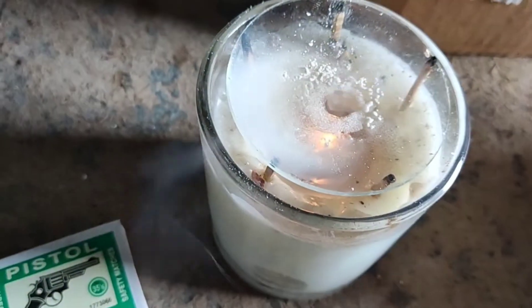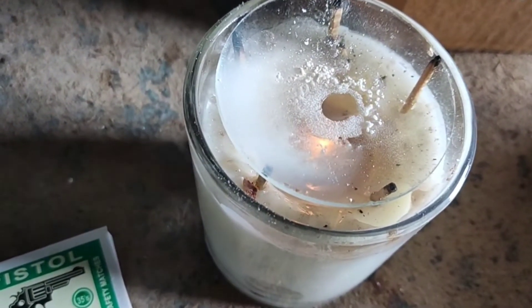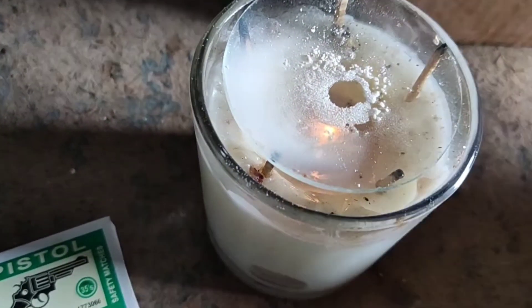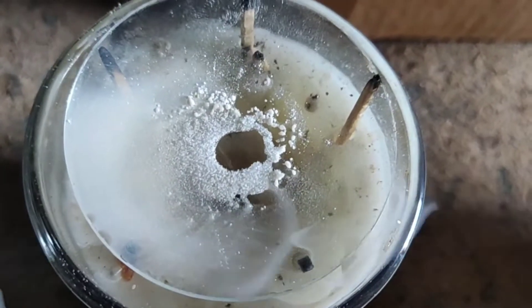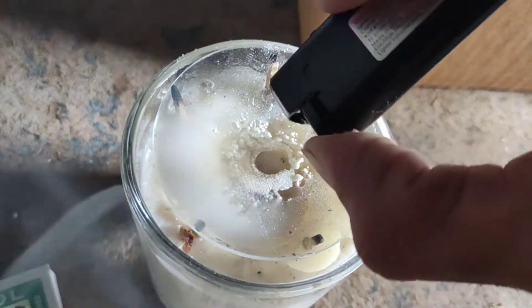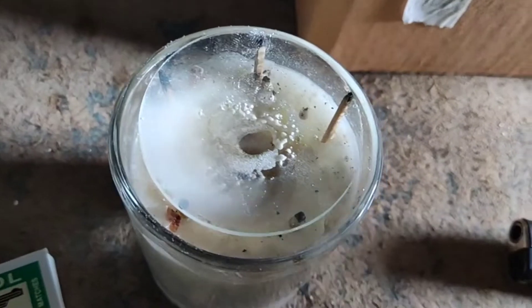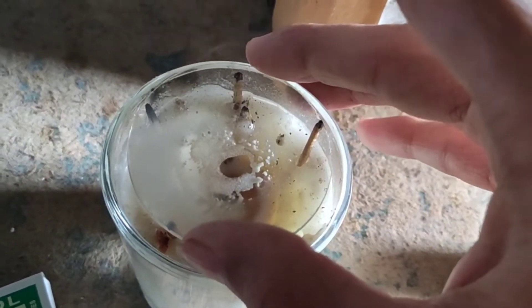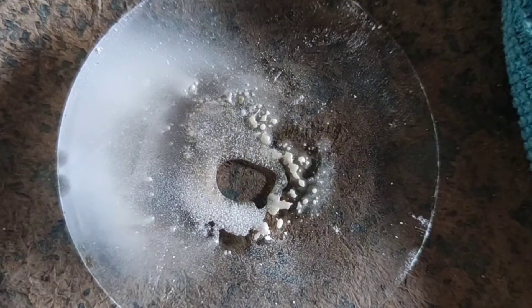There are crystals because the vapors were caught on the watch glass surface — the watch glass has a curved surface. I got a few crystals, which is enough for making a precursor crystal or seeding the solvent process. I'm heating it again just to be sure there are more crystals. We'll now look at them under the microscope — you can see the small crystals there because the vapor condensed.